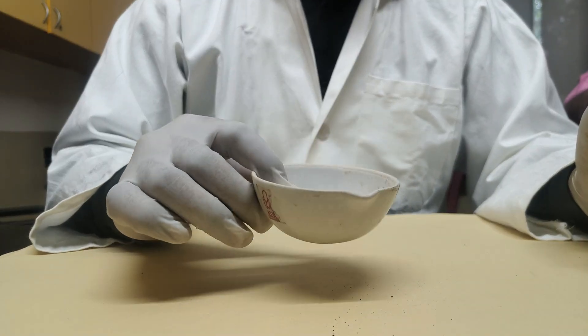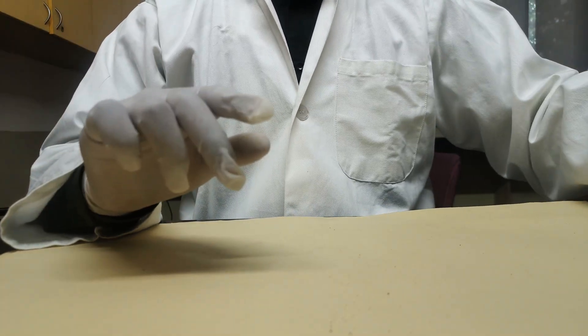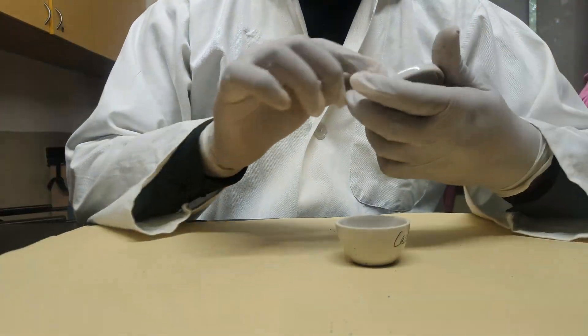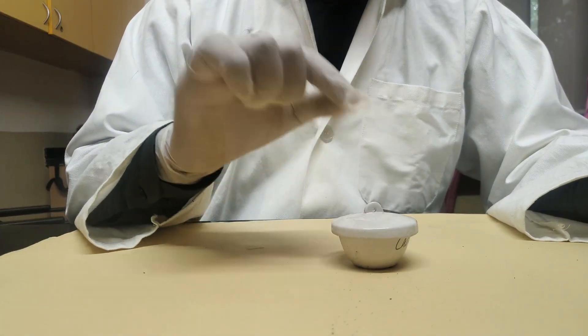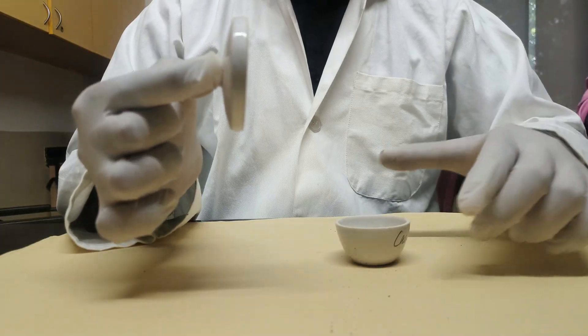Next item is the crucible. It is very important for heating at very high temperatures. It contains two parts: the lid and the crucible itself. The top part is called the lid, and the crucible is used for high-temperature heating processes.